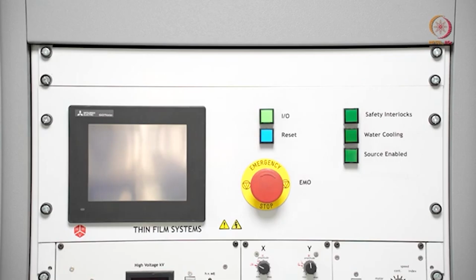All these things are part of the safety interlock. When we operate the tool, we will show again how vacuum affects it and how opening doors will affect it. Though it is not recommended to leave the doors open and run the tool, because that will be an electrical hazard for you.